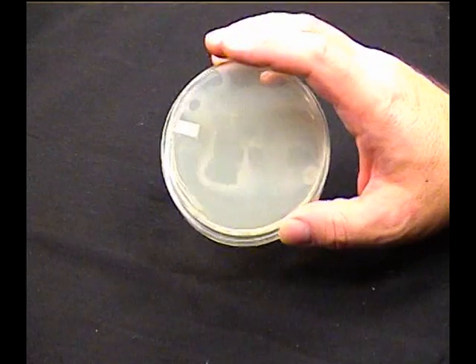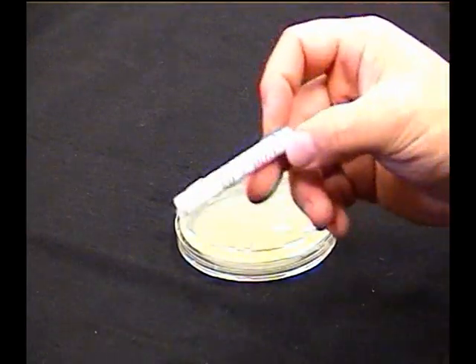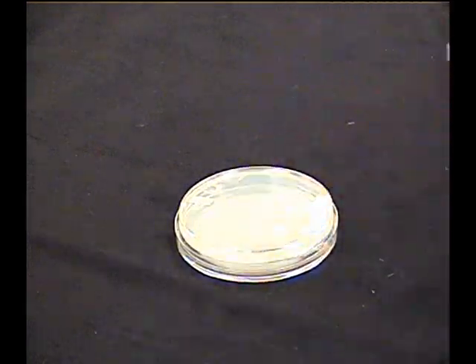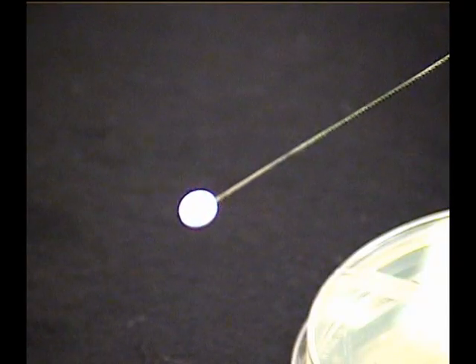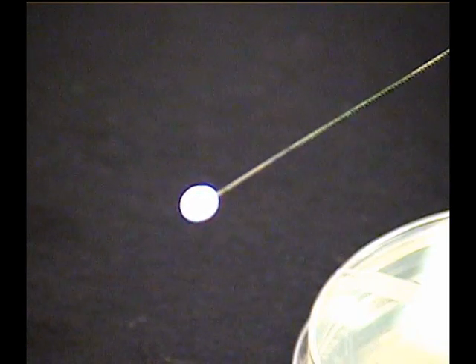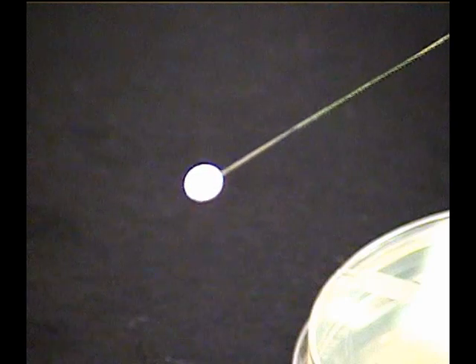a TSA plate and a bunch of antibiotics on little filter paper discs. They're impregnated with a given amount of an antibiotic and the discs are marked.